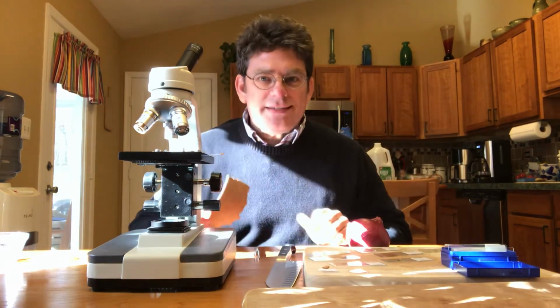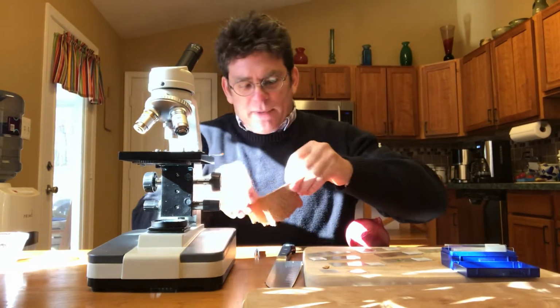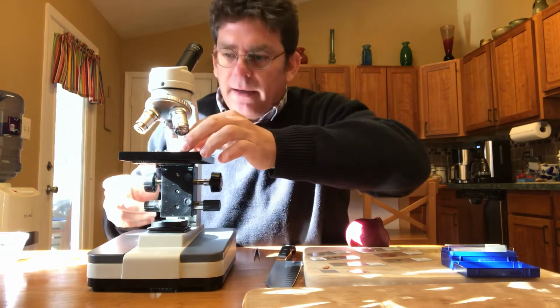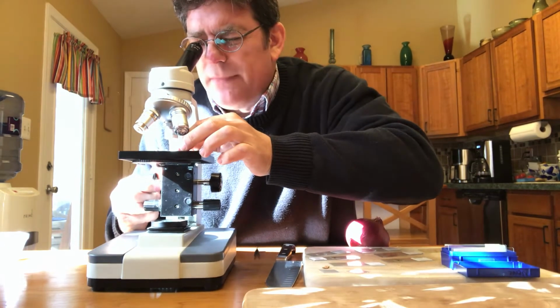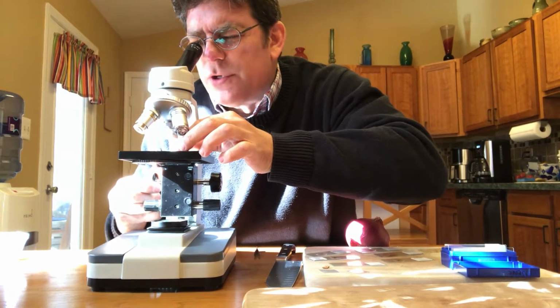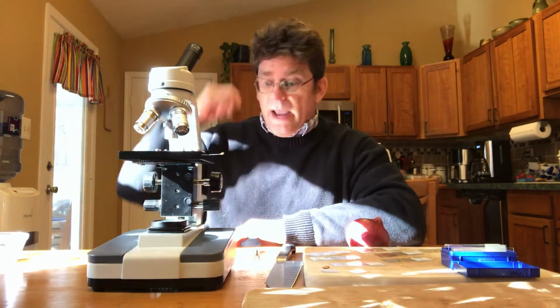So the trick with seeing cells with a light microscope is to get a thin piece. So really, if I break off a little piece of this cork and I take a look at it, I'm not going to see great cells unless I look at the edge where it's torn, because that's where I can get a thin enough piece. And what I'll see almost looks like little kernels of corn or something like that, where I can bring it into focus.